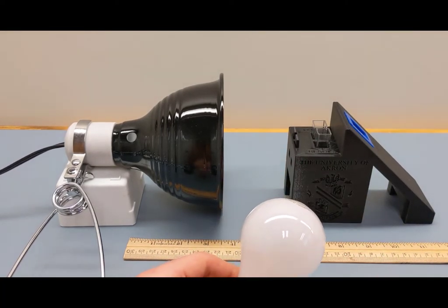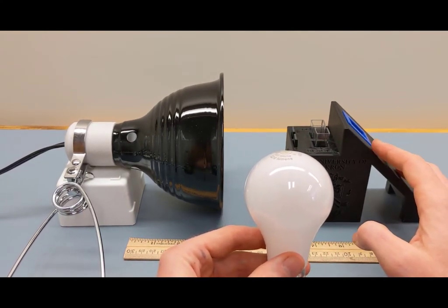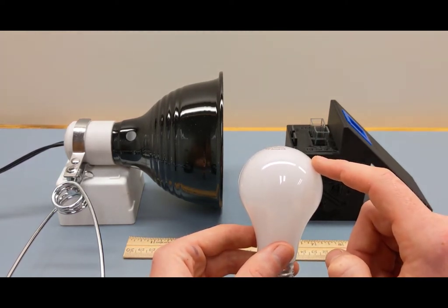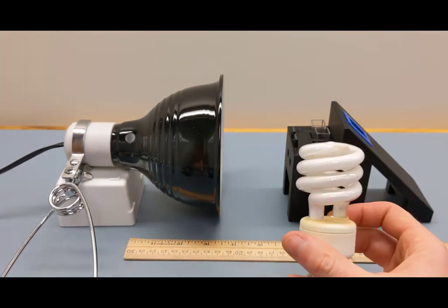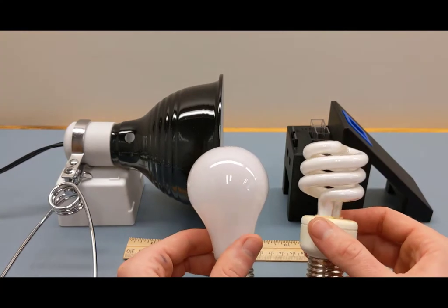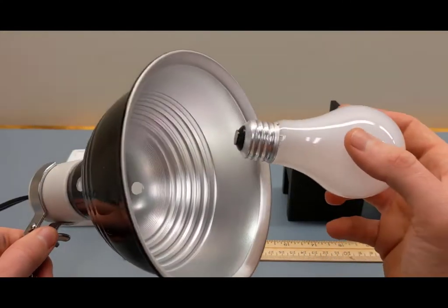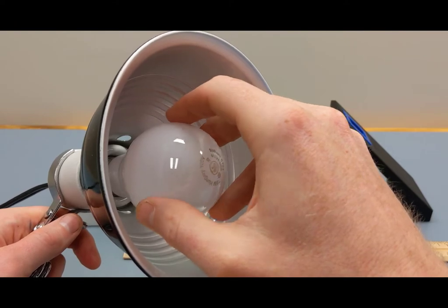When we shine this light onto our camera sensor, the sensor doesn't intrinsically know what wavelength is being shined — it just sees colors. To calibrate the specific wavelengths, we need a source with known wavelengths, so we'll also use a compact fluorescent bulb. You're shipped with both light sources. Start with the incandescent bulb and insert it into the socket very gently — this is a thin piece of glass.